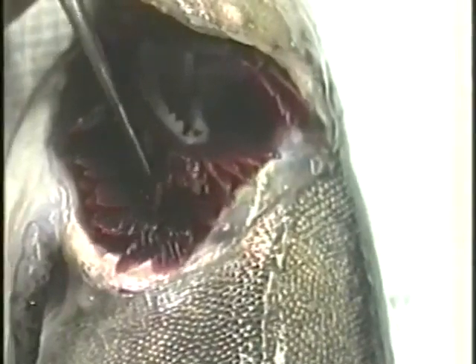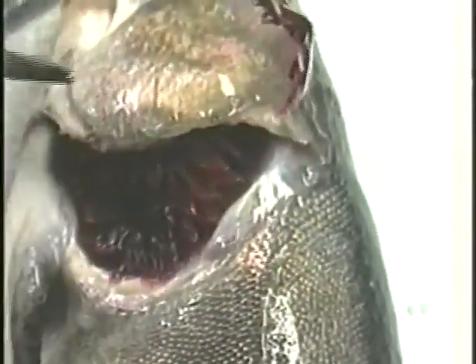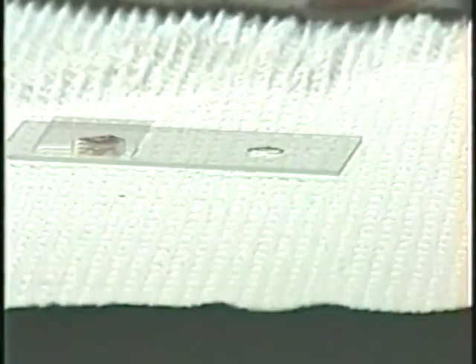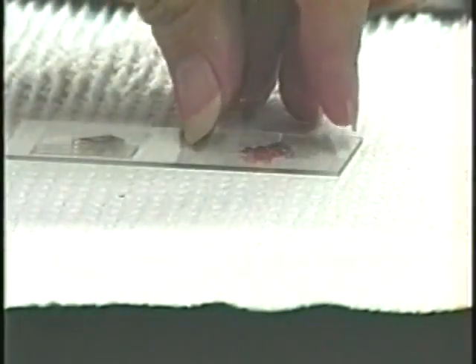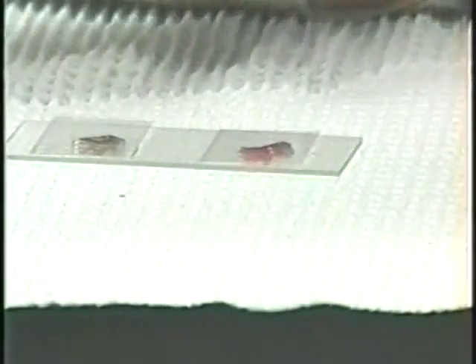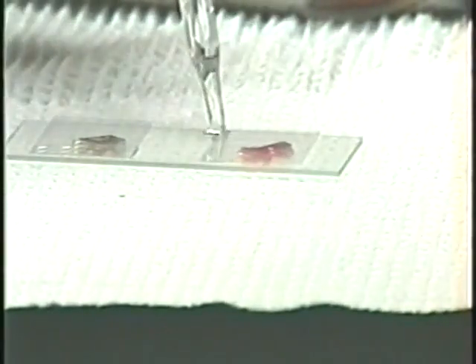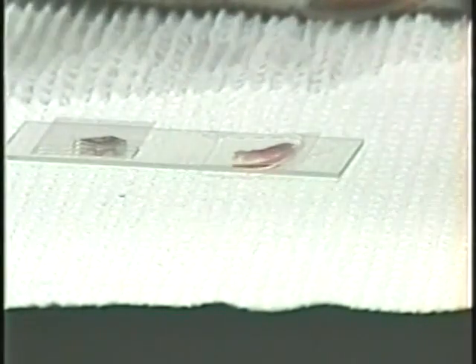then carefully cut out all or a portion of a gill arch. This is done by grasping the arch by the cartilage with forceps and cutting it out using a scalpel or small scissors. Lay the gill in a drop of water on a clean microscope slide. If the gill is large, remove the cartilage with a scalpel, then gently lay a cover slip over the gill filaments and add water if necessary.